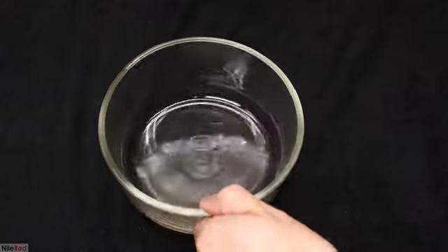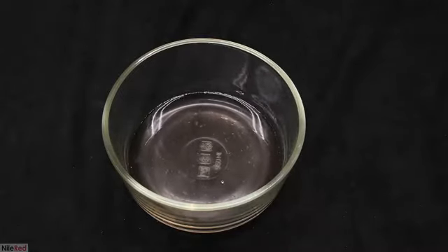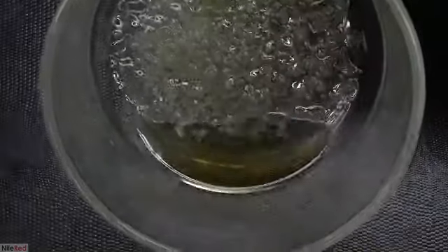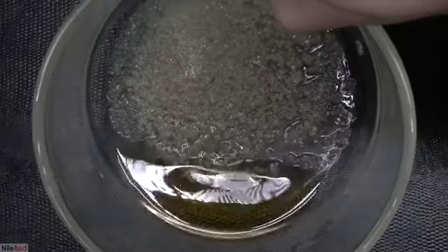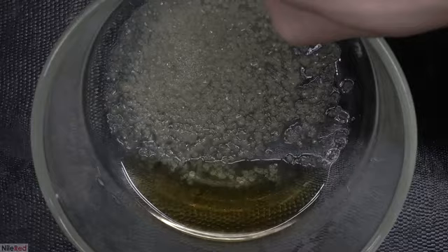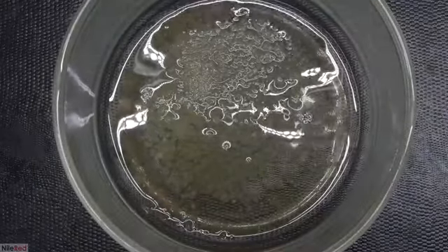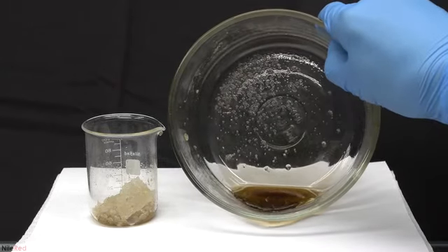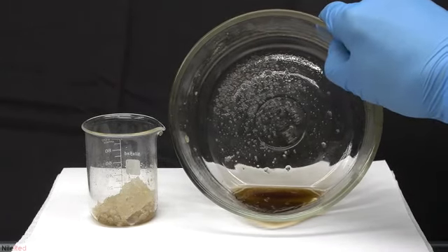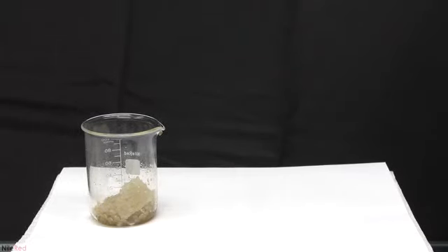After letting it evaporate for about a day, we can see that some crystals have started to form. I then left it out for about a week, and this is what I saw when I came back. I let it evaporate further for another week, and then I transferred the crystals to a small beaker. In the bowl, I'm left with a viscous brown goop, and this can be discarded. The small amount of crystals that you see in the bowl here were also transferred to the beaker.